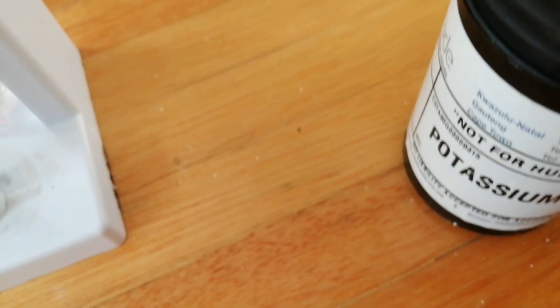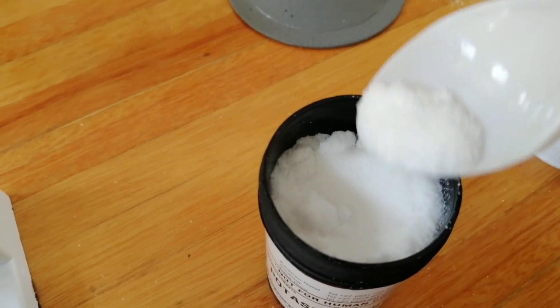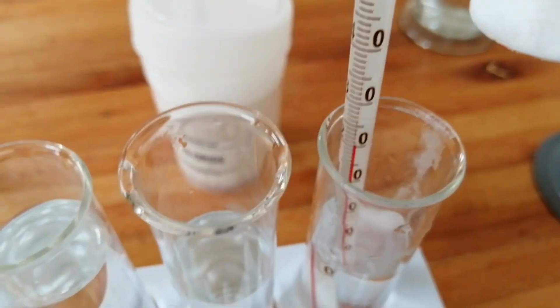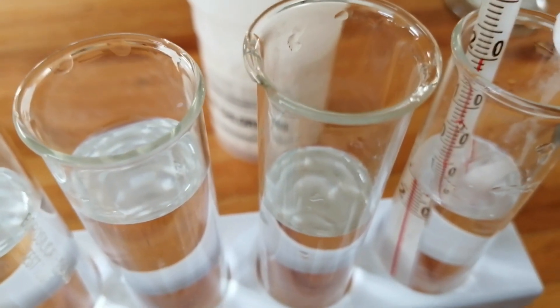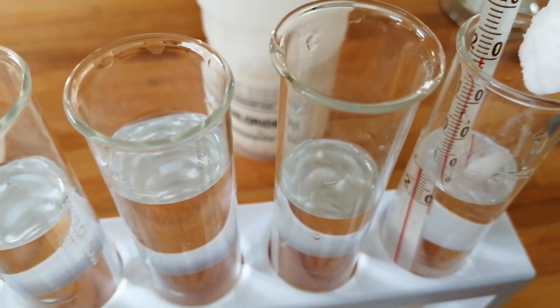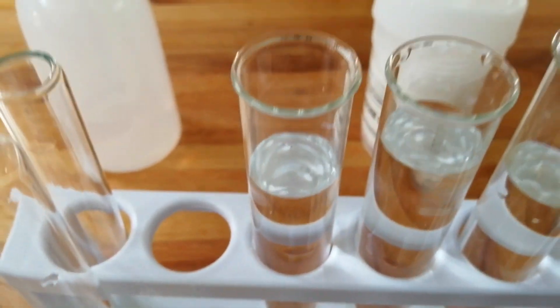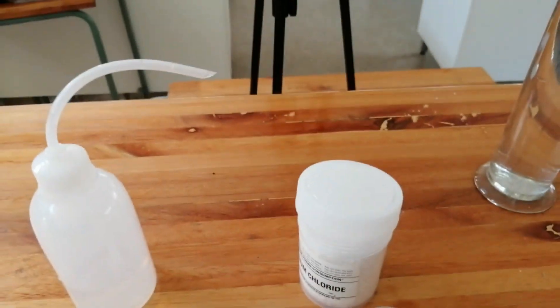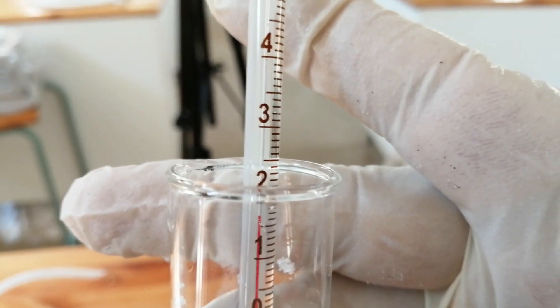This is potassium nitrate. I'm going to drop it into the test tube, and at the same time you must check the temperature — watch what happens immediately. Now potassium nitrate is in the solution. Let's see what happens to the temperature.